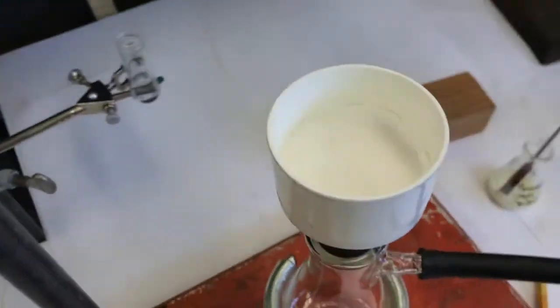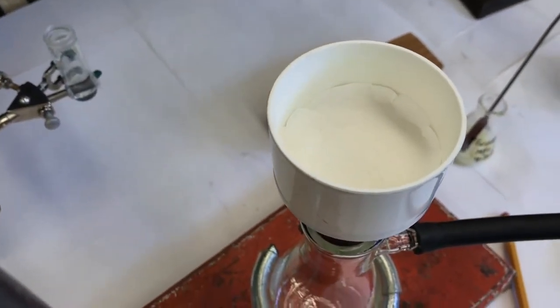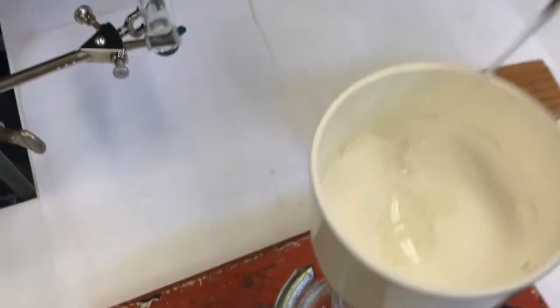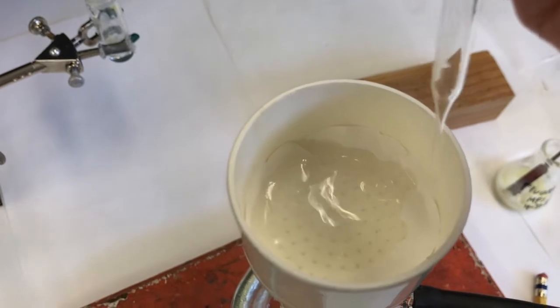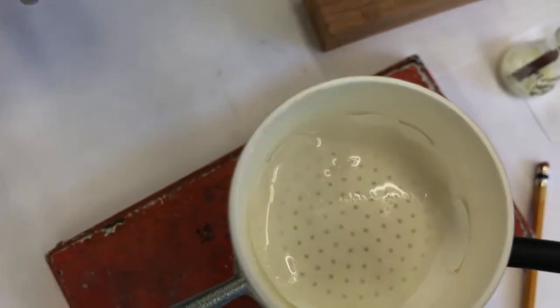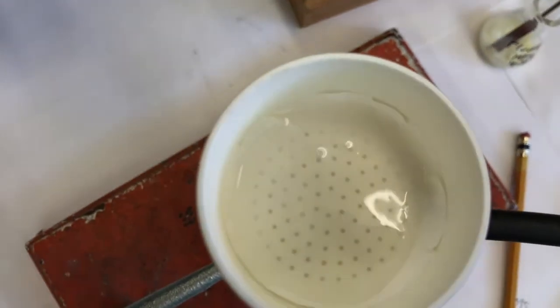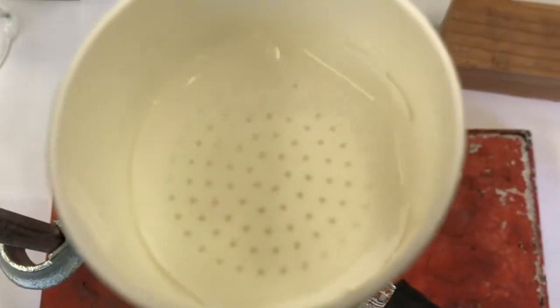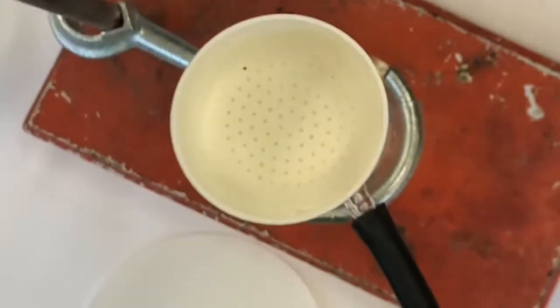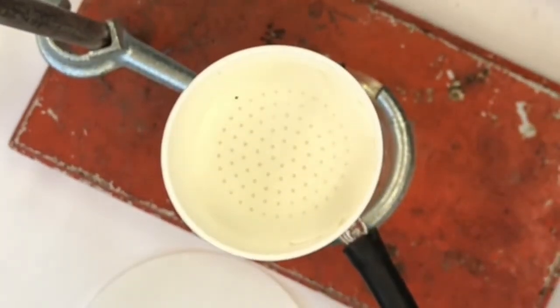So I'll wet down the filter paper with a little bit of this 80-20 methanol water. It's going to suck the filter paper down on the holes in the Buchner funnel so that I won't have as many crystals escape around on the outside. Okay, giving you a nice bird's eye view of me trying to get these.